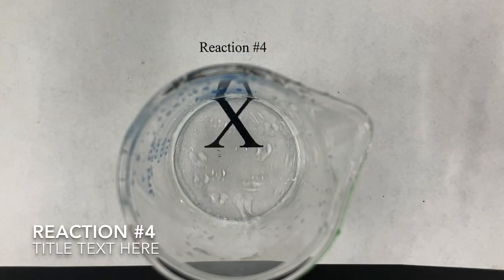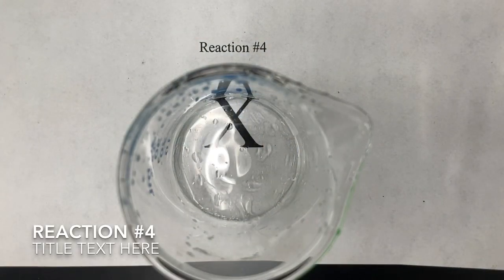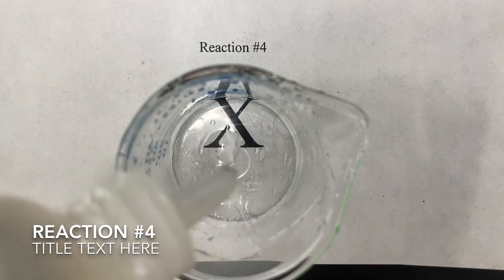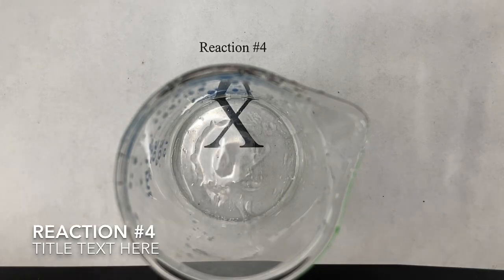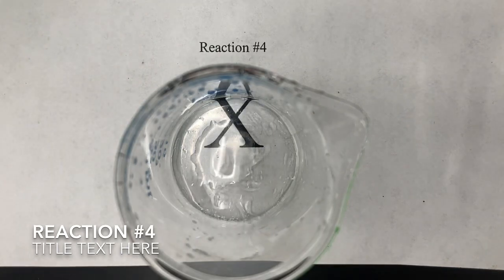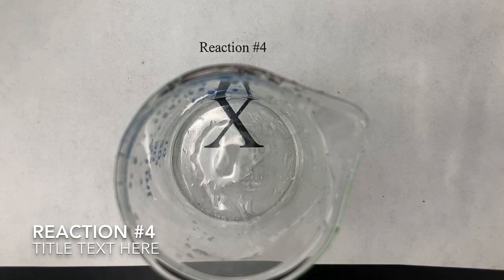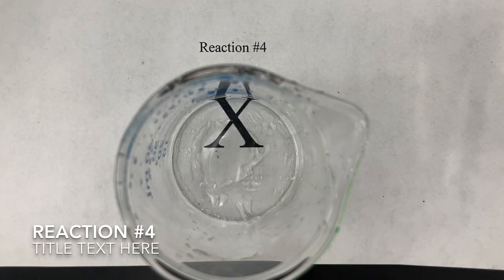All right, for the very last reaction, reaction number 4, we're going to add a few drops of lead nitrate to some sodium hydroxide. So again, I'll start with the sodium hydroxide, but take a moment to predict what do you think is going to happen when I add some lead nitrate, PbNO3 here. Looking at that chemical equation, is equilibrium going to shift to the left or to the right when I add lead nitrate? So you should be looking at 4A here.